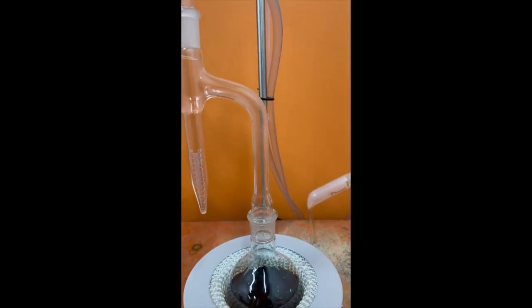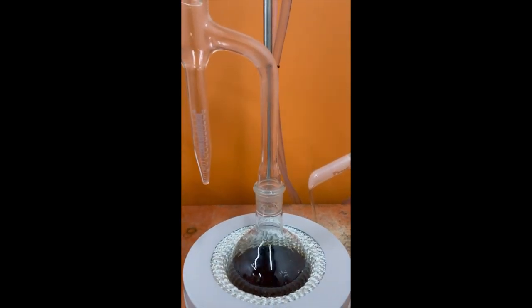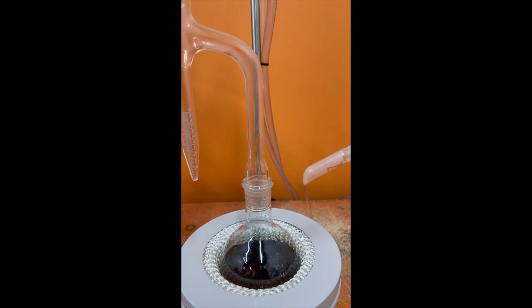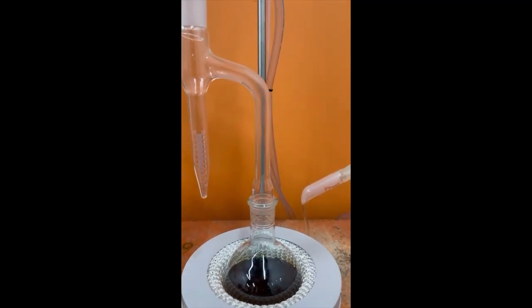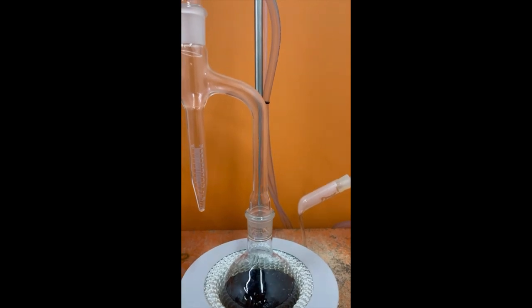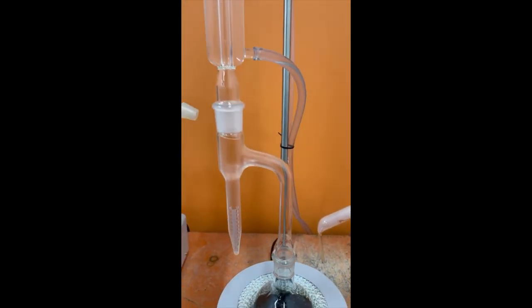So we will wait now. We are waiting to continue distillation until no water is visible in any part of the apparatus except in the trap, and the volume of the water in the trap remains constant for 5 minutes. Okay, this is the test.